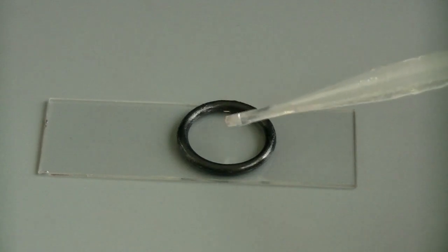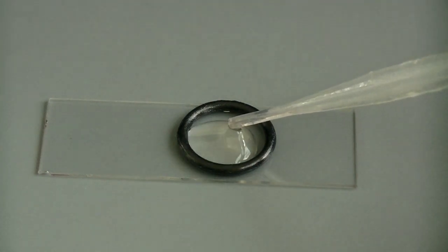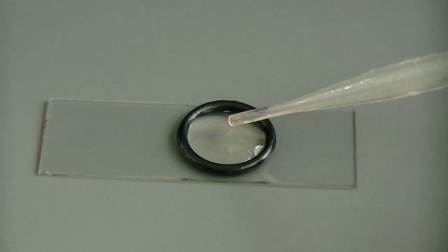Fill the O-ring with the plankton sample. This O-ring is 2.5mm thick and holds 10 times the volume as the depression slide.